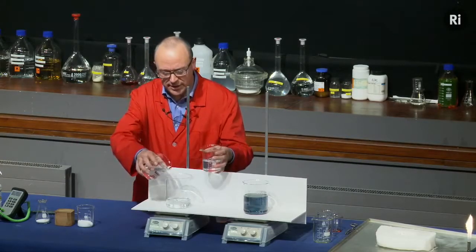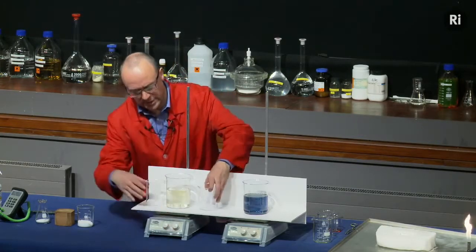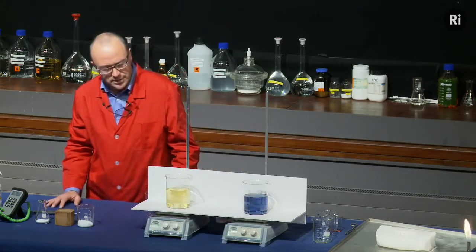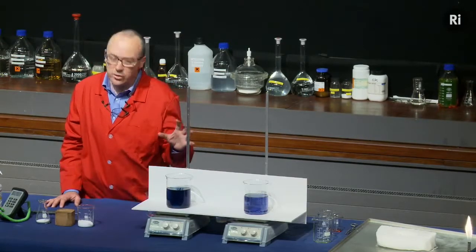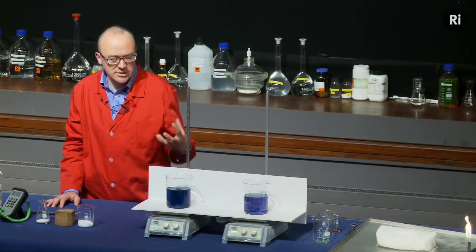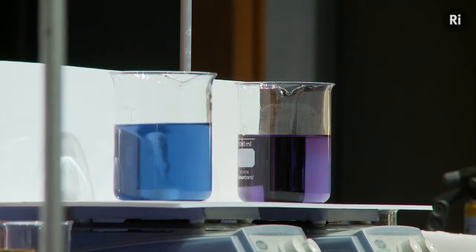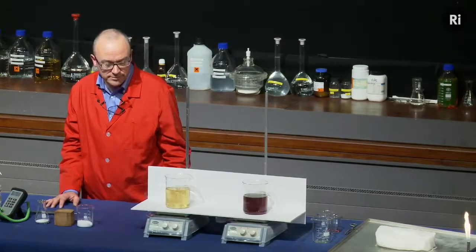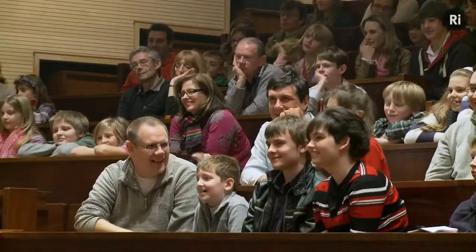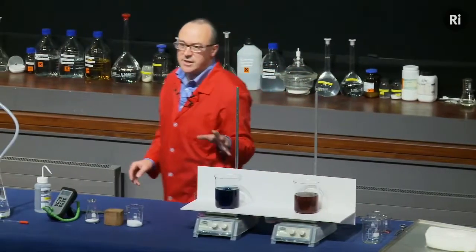So again, I have a clear liquid, I add a second clear liquid, and a third clear liquid, and it turns amber. We'll keep watching. It turns blue, very dark blue. So that's a little bit like the clock reaction. It's the same thing, it's the reaction between starch and iodine. But this time, it doesn't stay blue, it's going clear again. So it's become clear, now it's going back to amber, and if we keep watching, back to blue again. Okay, so those are two oscillating chemical reactions.